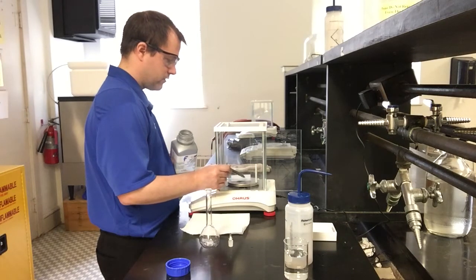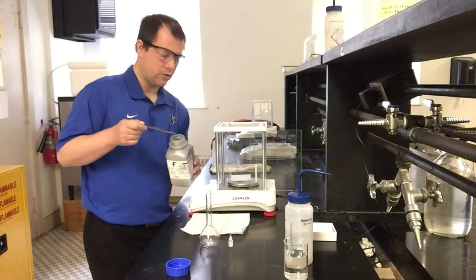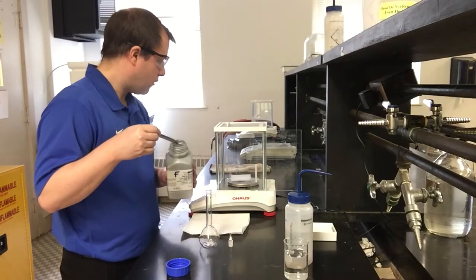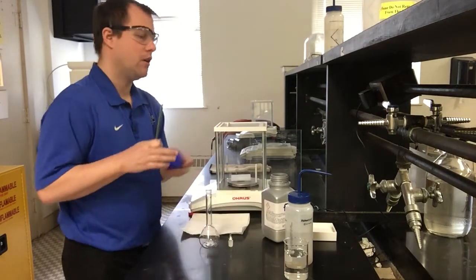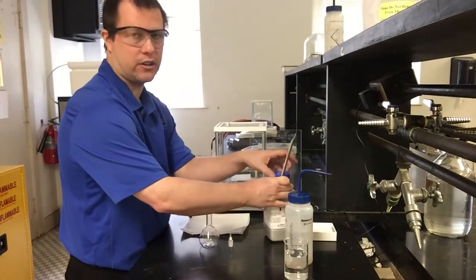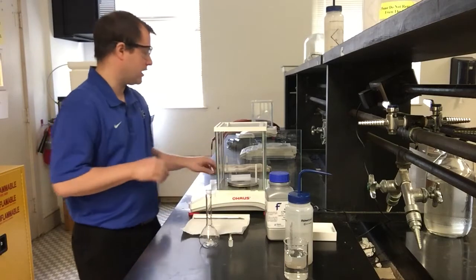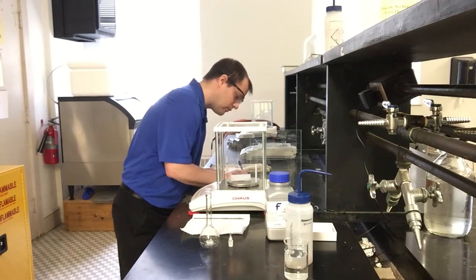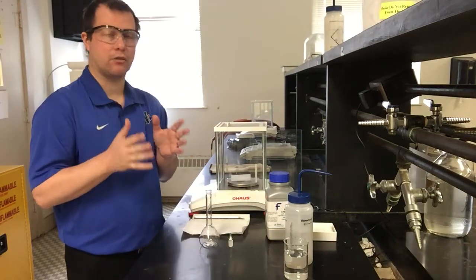Actually very close. And that's actually extremely close. Actually, probably going to just leave it right there. So we have 1.469 grams is what I see on our balance right now. So 1.469, it's very, very close to 1.47 grams. So that's what I'm going to leave things at. I'll record that number here real quick so we have it for later. So very close to 1.47 grams, which we want to make the correct concentration.